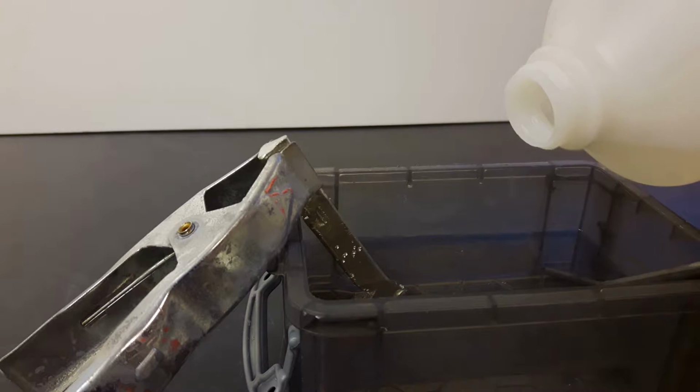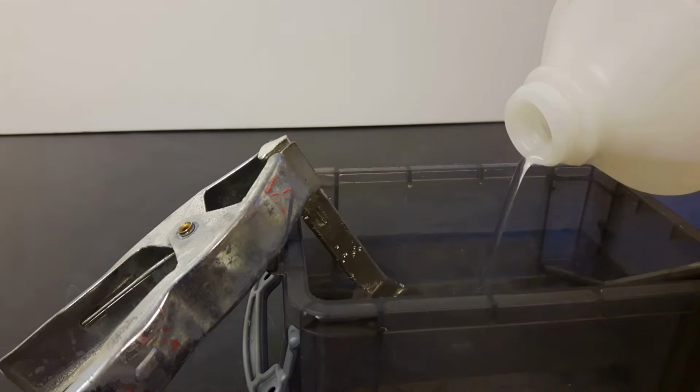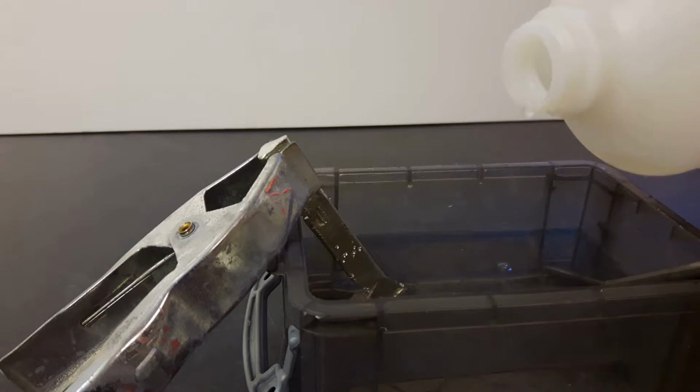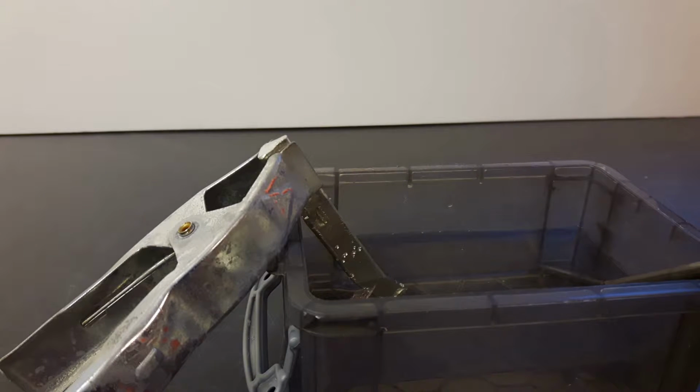But you have to make sure that you don't consume all of the hydrochloric acid either, because Stannous chloride in solution is only stable if there is some hydrochloric acid present. So I'll add a small bit. See the vapors coming out? That's hydrogen chloride. I think that's enough. And before it starts to react with the iron, I turn up voltage.